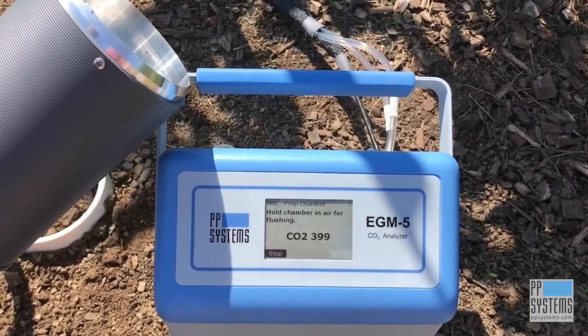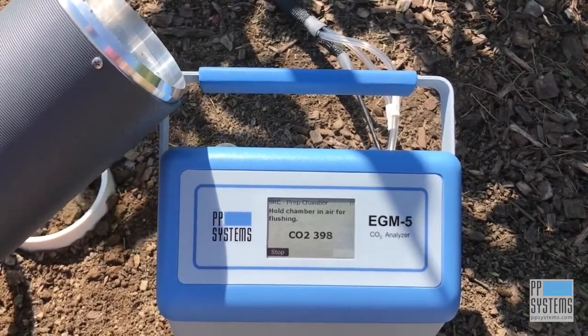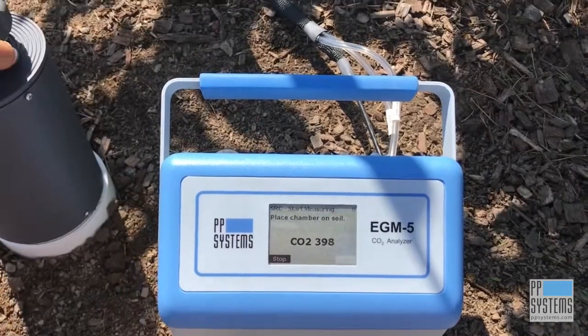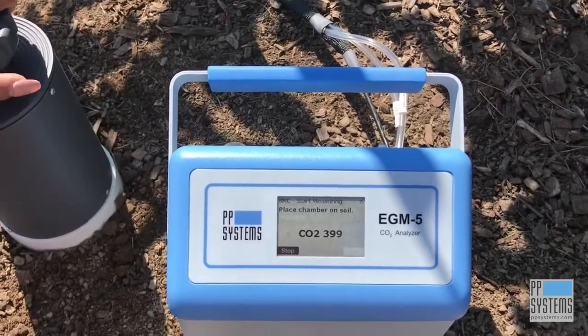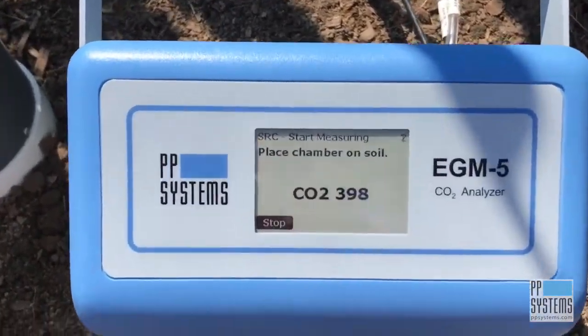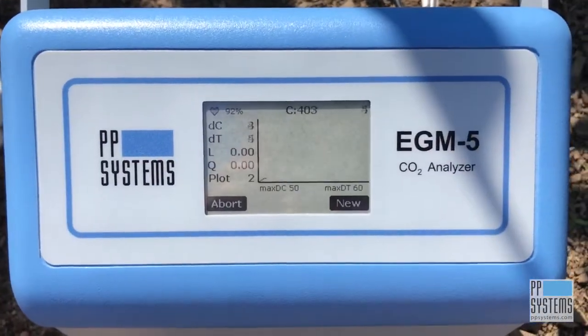When the system tells you, place the chamber on the soil collar. You'll now see your data being monitored, updated, and plotted in real time.